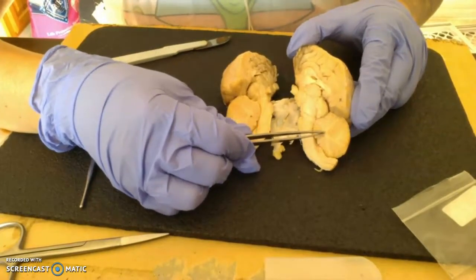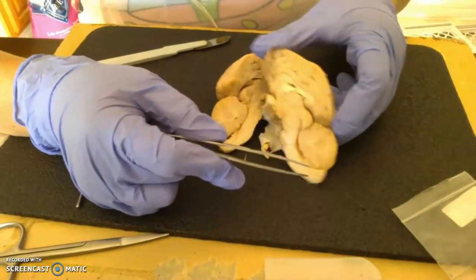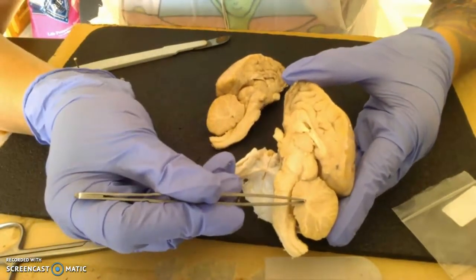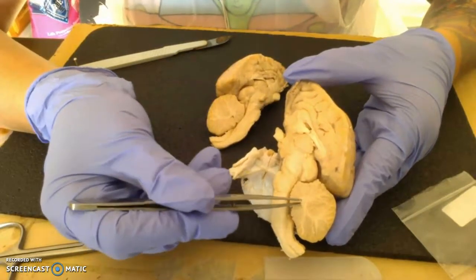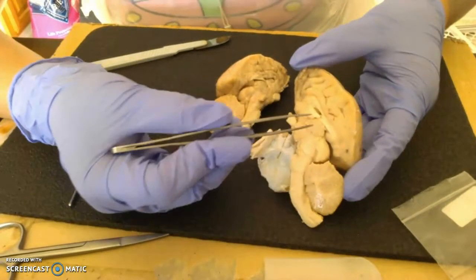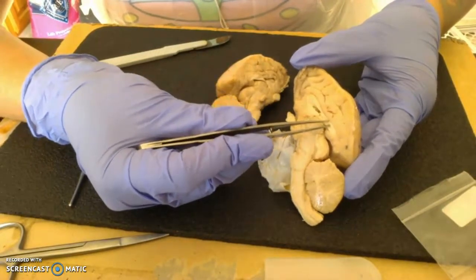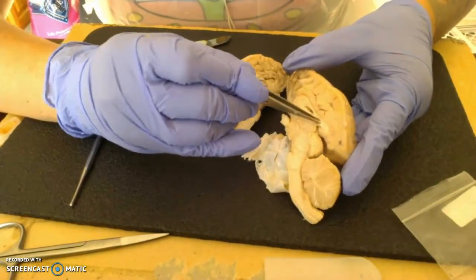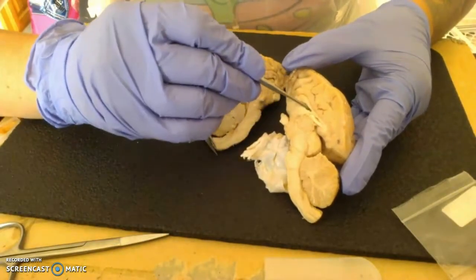At the cerebellum, we have the arbor vitae, tree of life, which actually is a better example of showing white matter versus gray matter, and the white matter is the actual arbor vitae that forms the branching. And then we can come back proximal to the brain. We have our corpus callosum, which is this long structure that helps form the cavity right here. Let's turn this on. So there's our cavity.